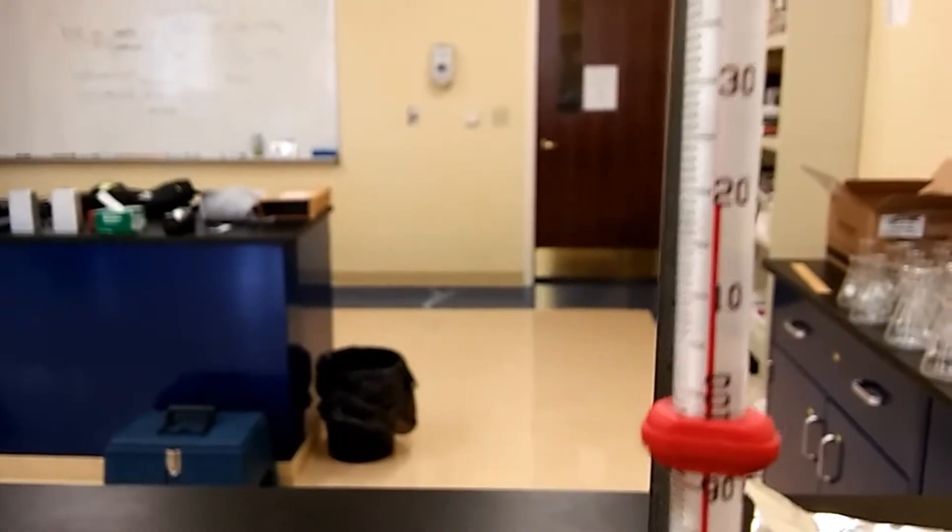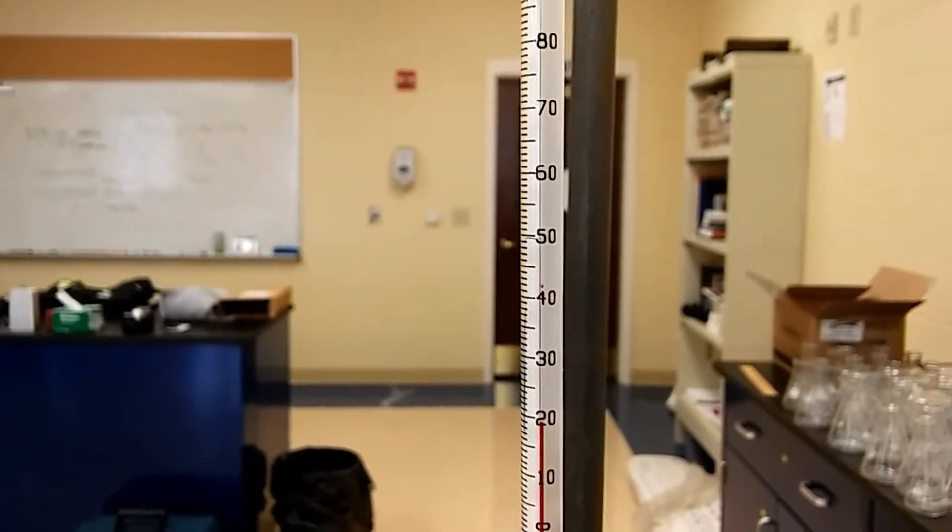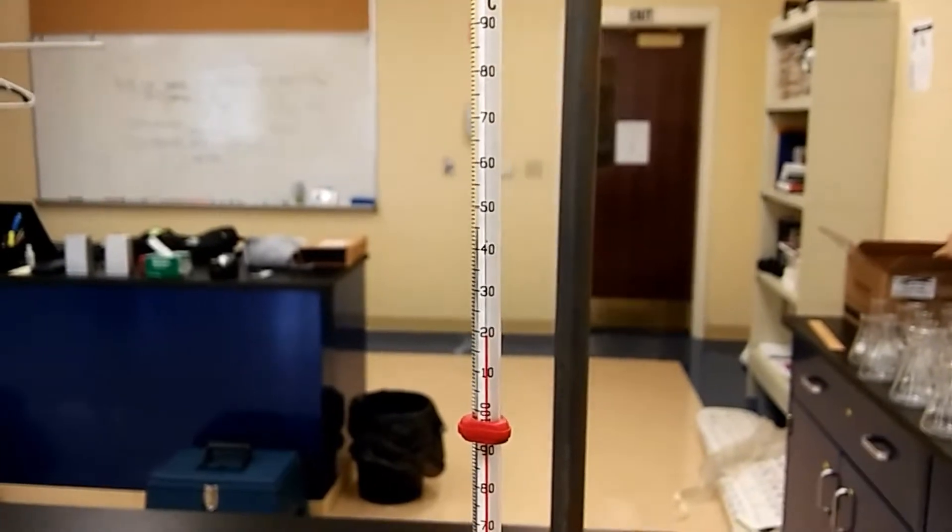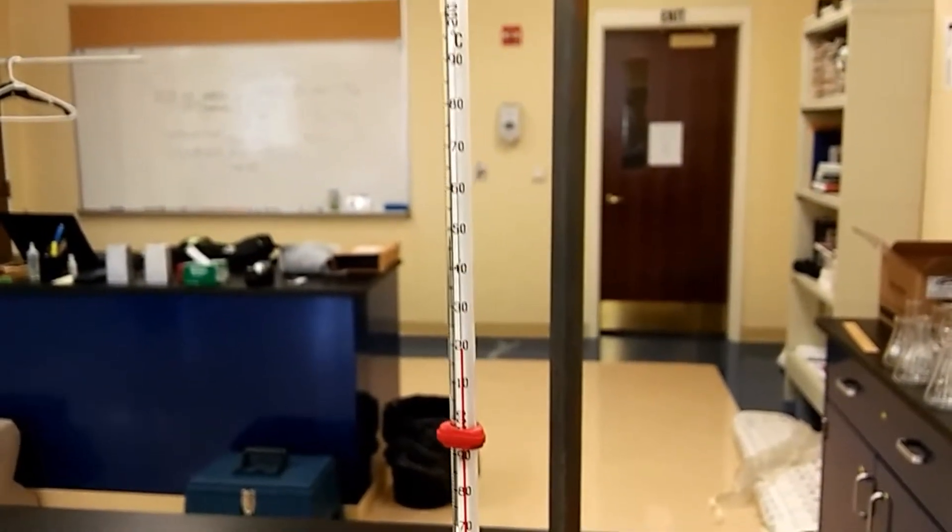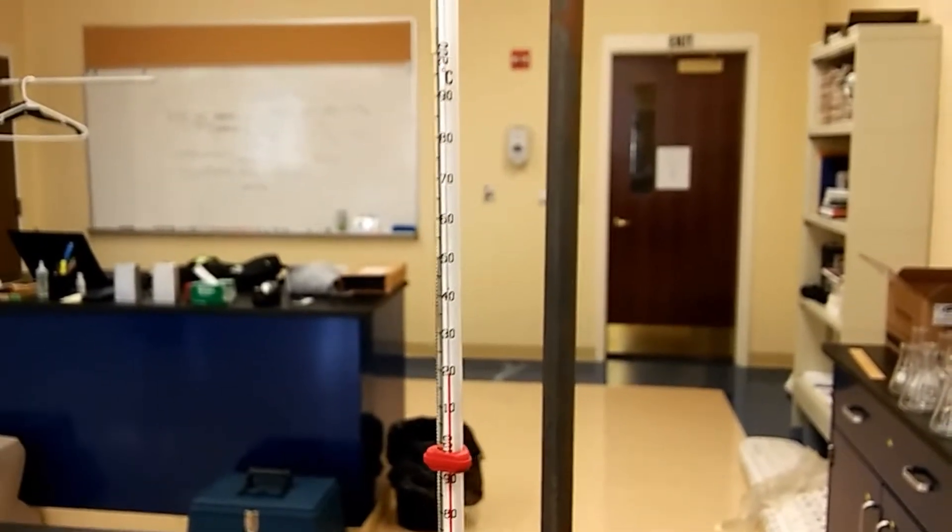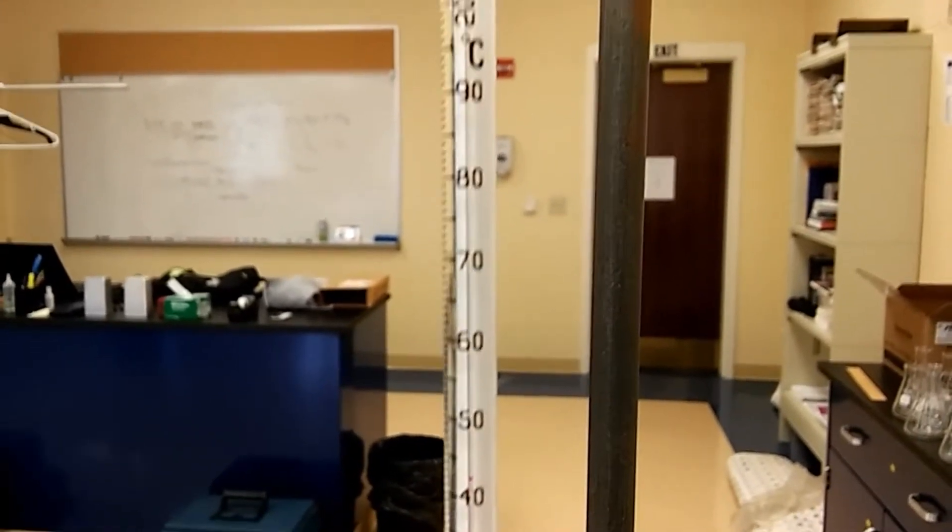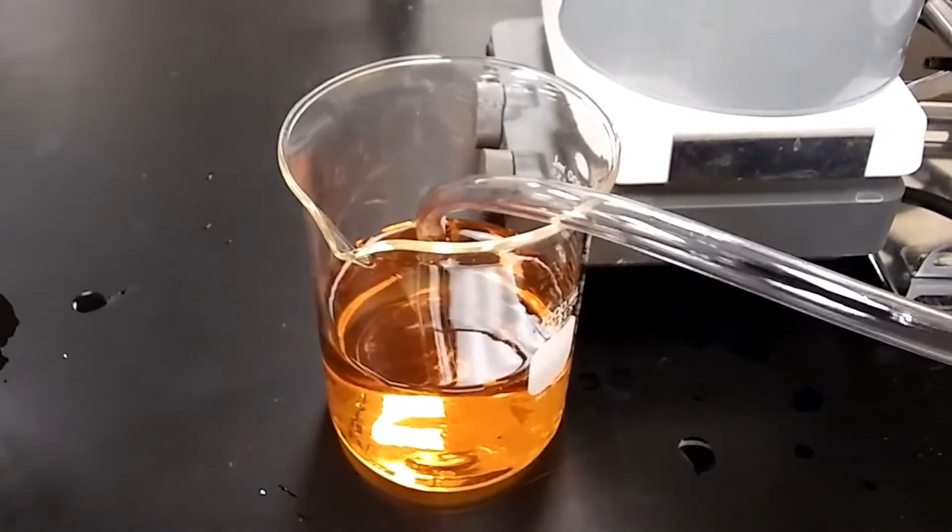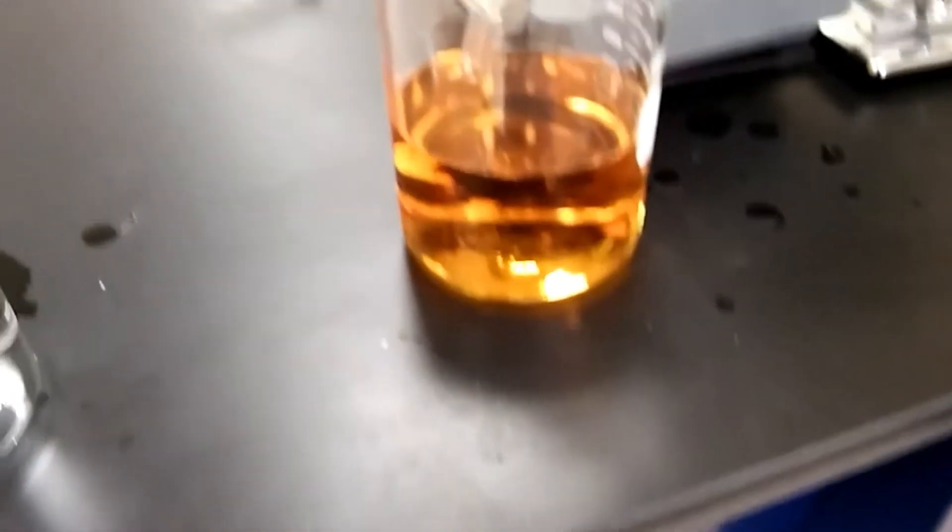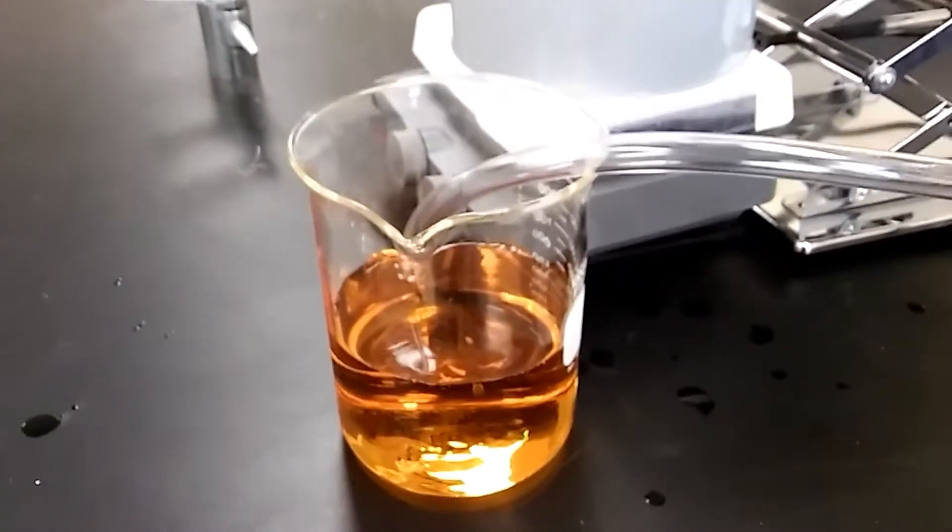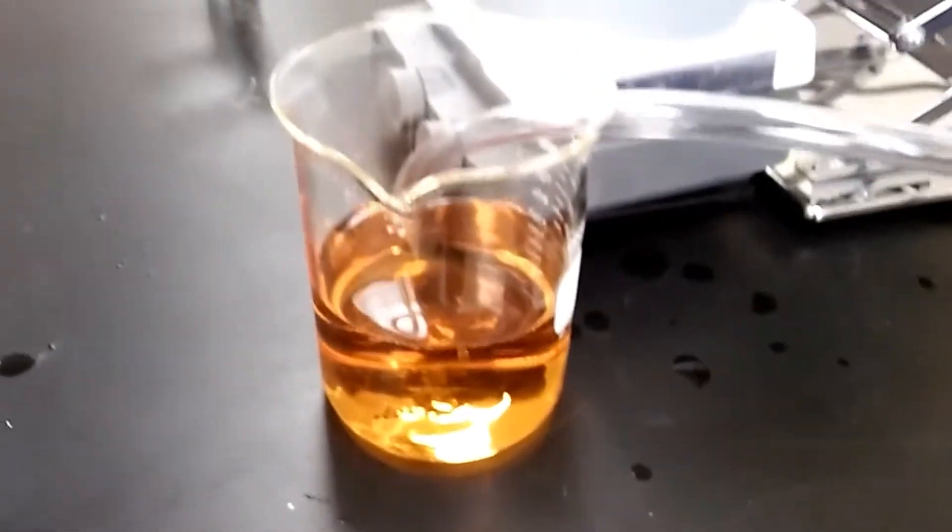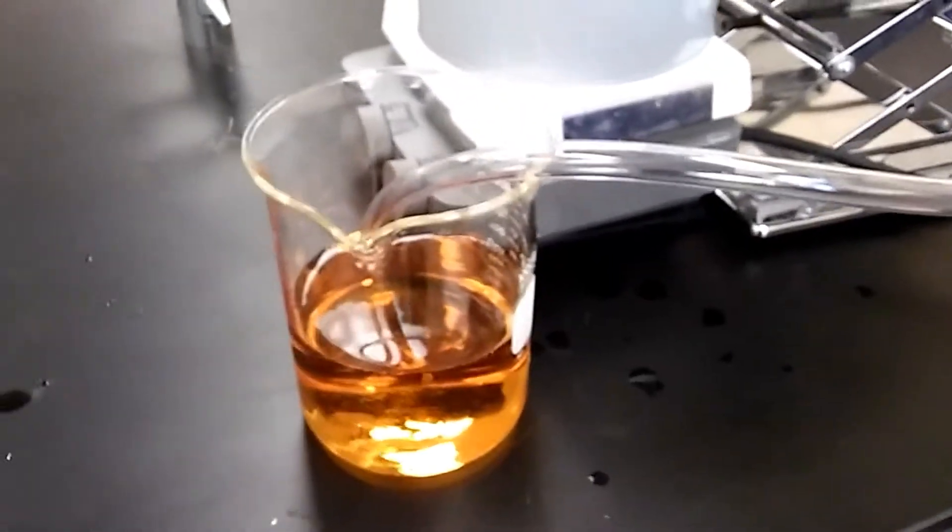The temperature is currently at about 120 degrees. The boiling point of phenol is 181.7. We're going to collect everything. I've already started collecting and I noticed there is some kind of a white murky liquid in it. But we're going to distill anyways again so I didn't really care. I'm going to go till the temperature gets to 181.7 or right about 182, and then I'm going to shut off the heat and the whole system come to cool. I thought I would be able to see the CO2 generation more clearly but I guess it was not enough CO2 in it. So you can't really see a whole lot of color change in it. It's not the same thing as your bicarbonate dissolving in vinegar making CO2. That was instantaneous. But hey, that's not a big deal that it didn't happen.